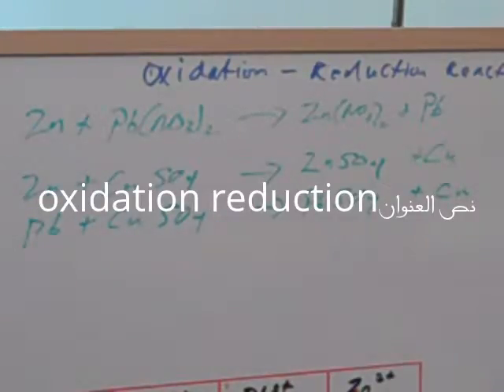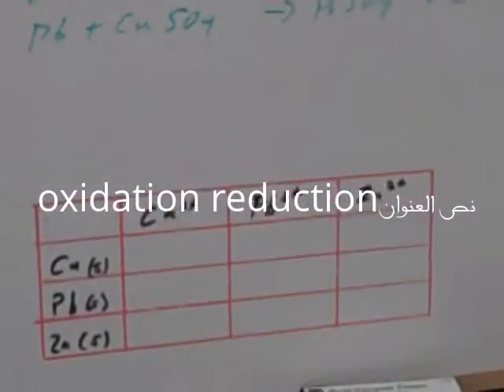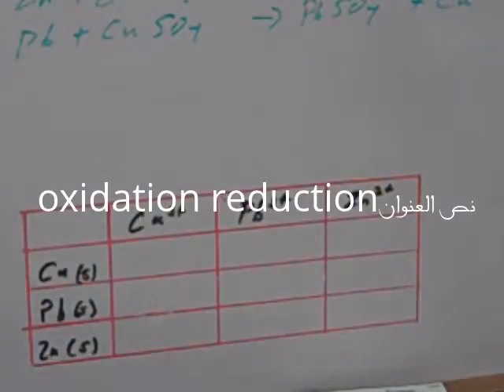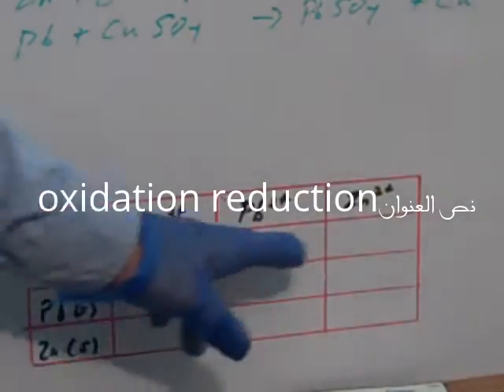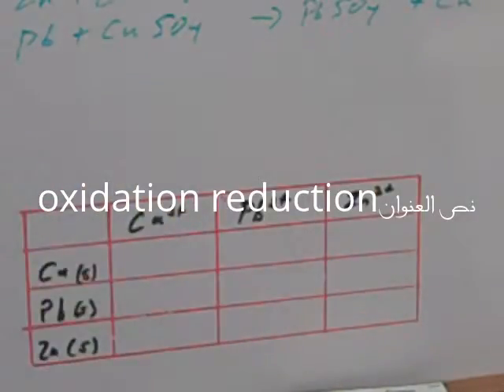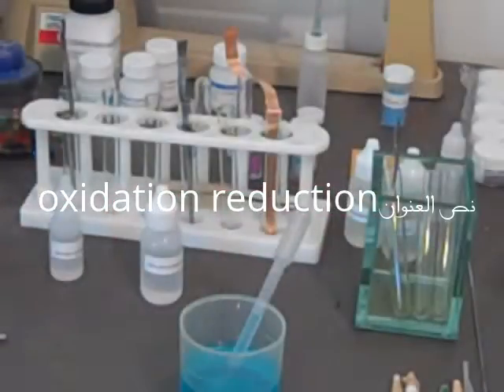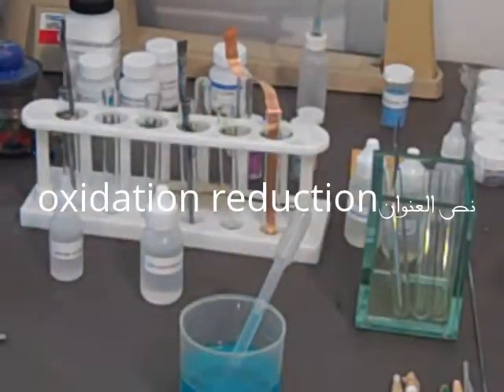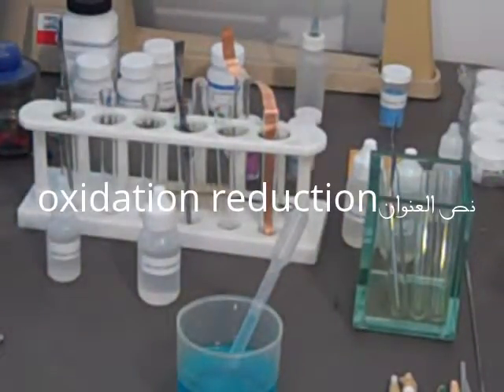Okay, we have three solutions: the copper sulfate, lead nitrate, and zinc chloride. We're going to add 3 milliliters of each. I'm sorry, I wanted you to see the table. We're also going to keep track of what happens and put in our observations in these rectangles as we go. This will probably help you in your home experiment. Okay, this is the first time we're running through this experiment, and I hope you remember what to do here.